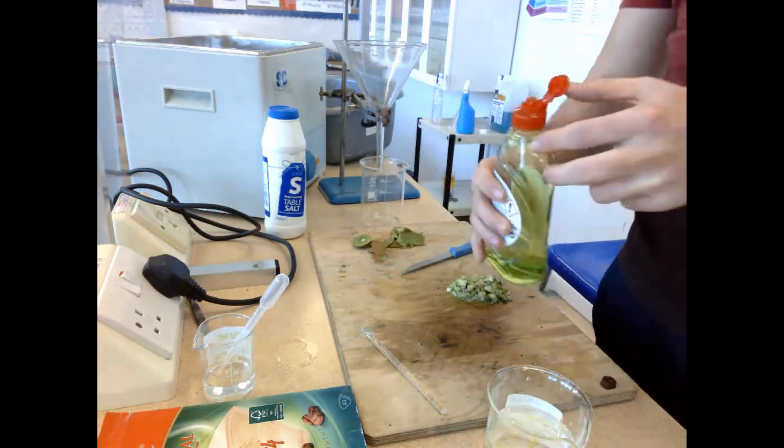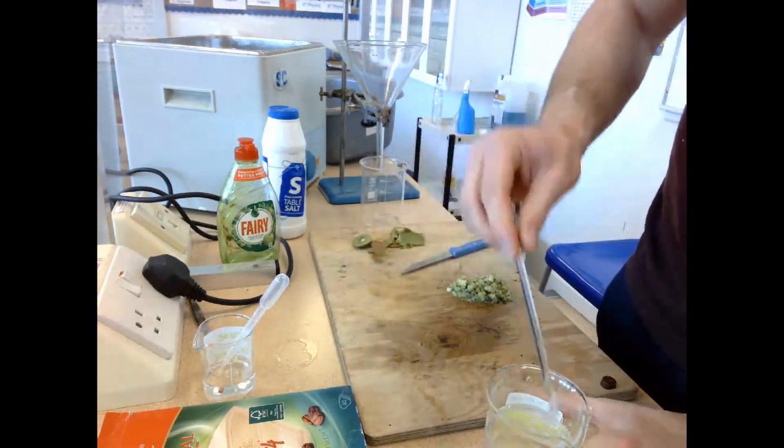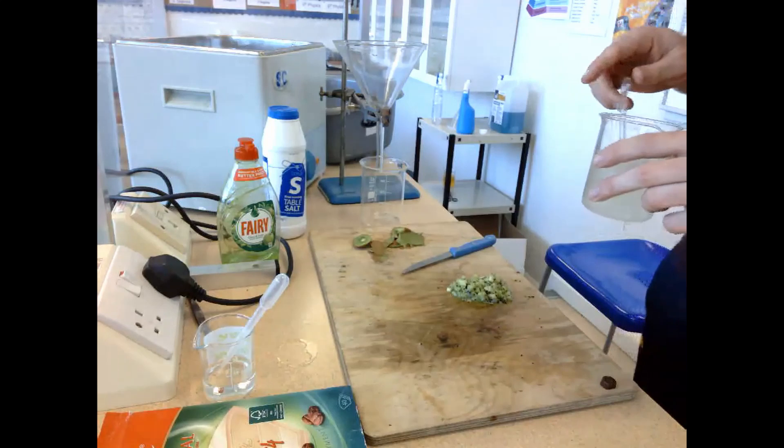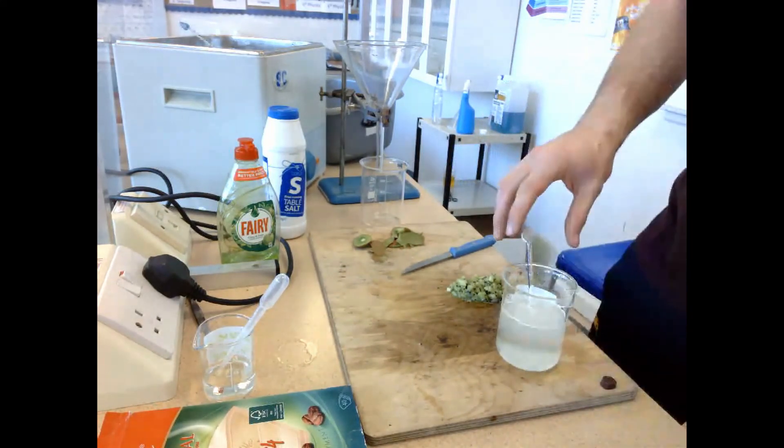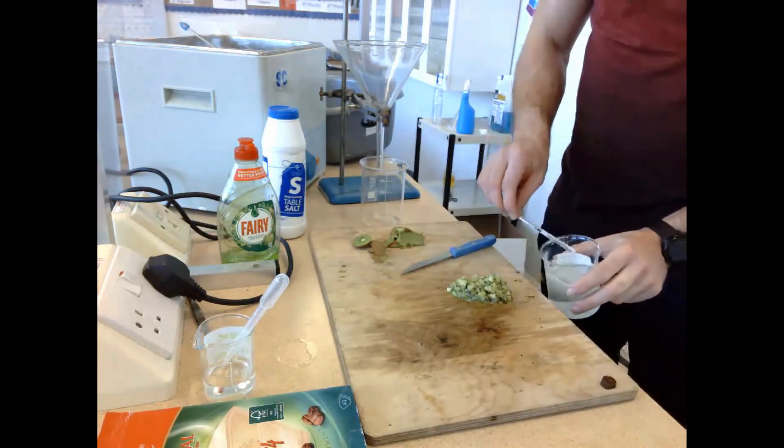We give that a quick stir, and then we're going to add in the chopped kiwi tissue. So once the kiwi tissue has been added into this solution, what we're going to do is we're going to add it into a water bath.